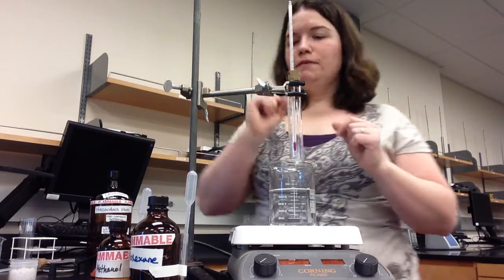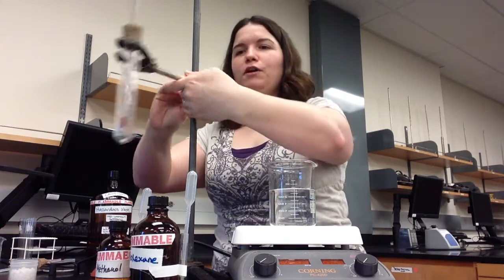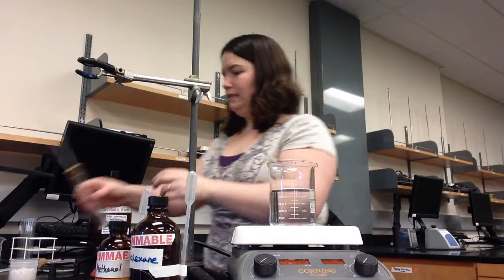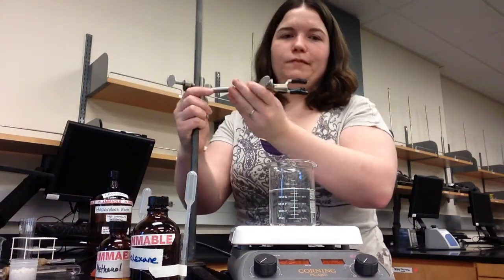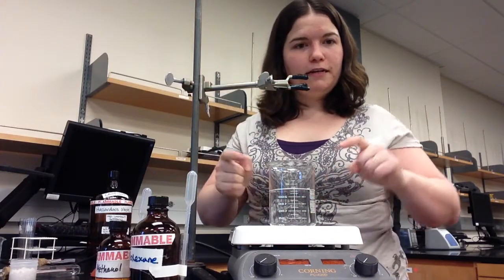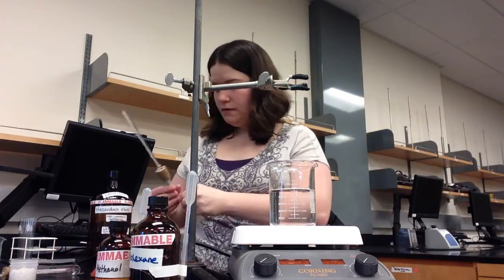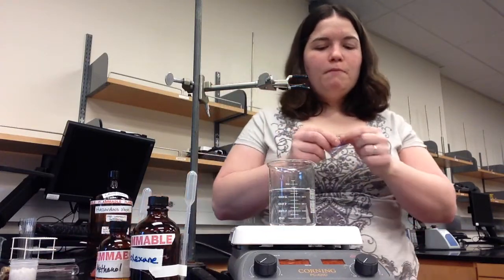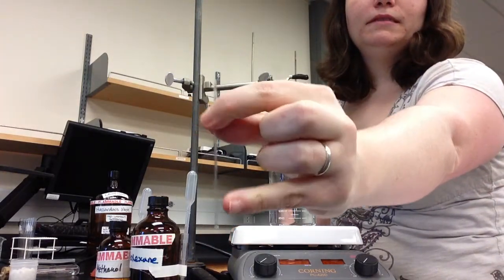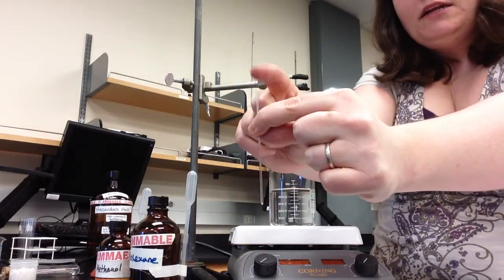You will still need a ring clamp, but instead of putting a test tube in, we're going to be putting a cork directly into the ring stand, into the test tube clamp. So I have my ring stand, my test tube clamp, beaker of water ready to go, hot plate still off because I'm not ready to heat it yet. We'll be measuring the melting point of our unknown solid by putting the solid into a capillary tube. It's a little bitty tube, looks like this. It has a closed end on one side and an open end on the other.